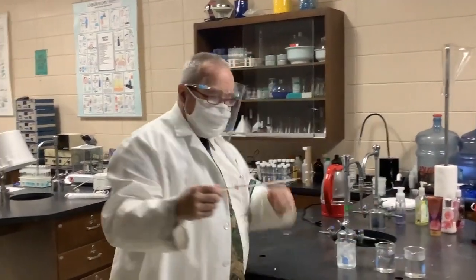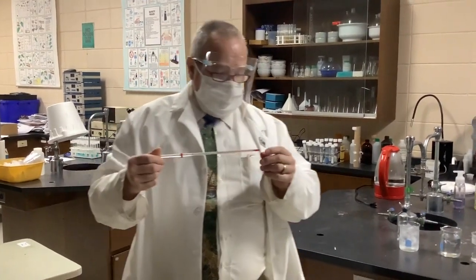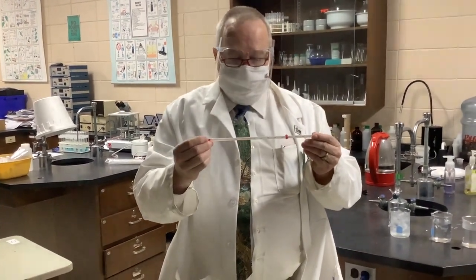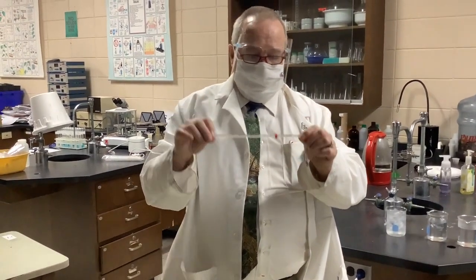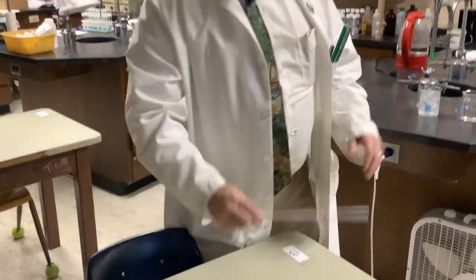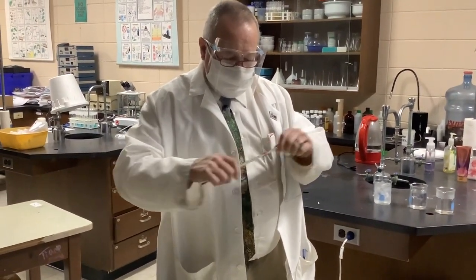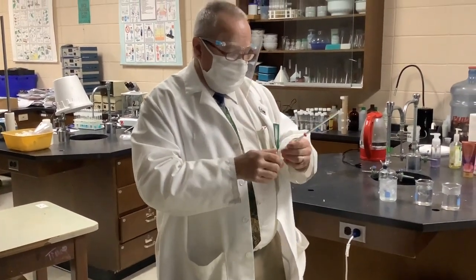This is a standard laboratory thermometer. We now tend to use ones filled with alcohol, colored with red food dye, and lots of people ask what this was. This is called a thermometer bumper. It just keeps it from rolling off. I noticed some of the students using it to remember where the liquid inside the thermometer rose to, to record and remember it, but we'll remember our values.